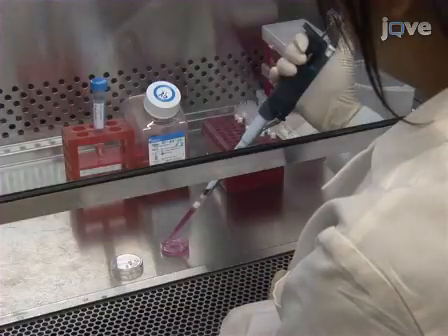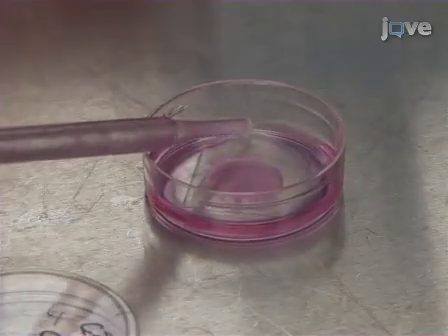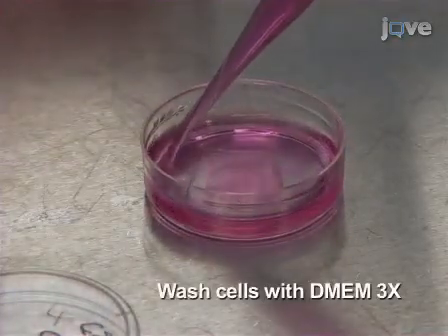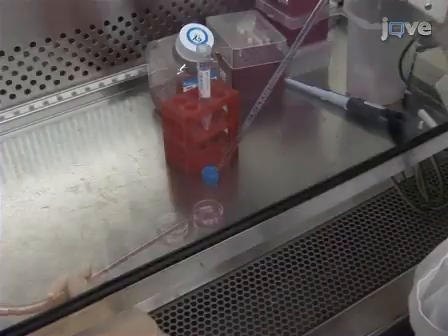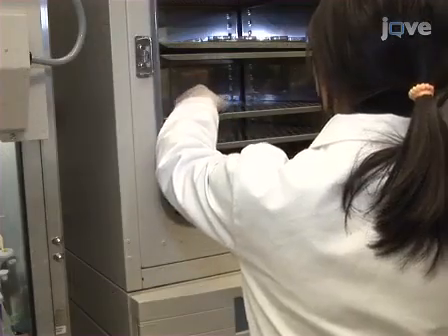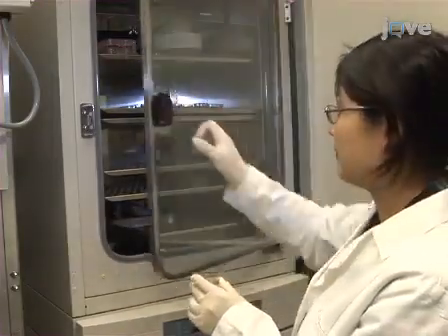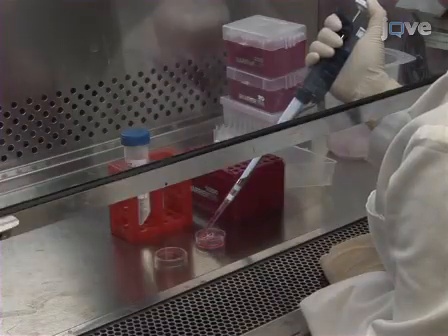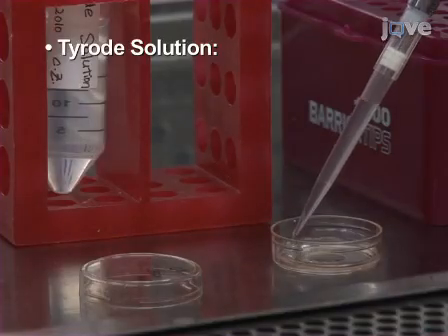Following incubation, remove the calcium phosphate containing medium from the culture dishes and wash the cells with DMEM, repeating the DMEM wash a total of 3 times. Exchange the DMEM medium with the original culture medium before returning them to the incubator. Neurons are used for the FRAP experiment 2 to 4 days after transfection. To begin, replace the culture medium in the 35mm glass bottom dish immediately with pre-warmed Tyrode solution.